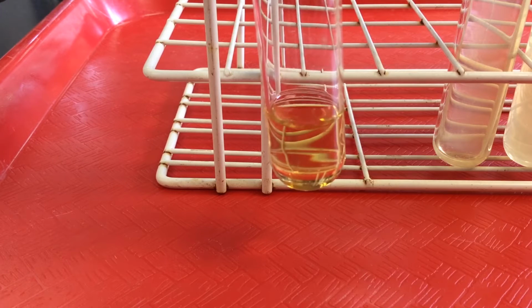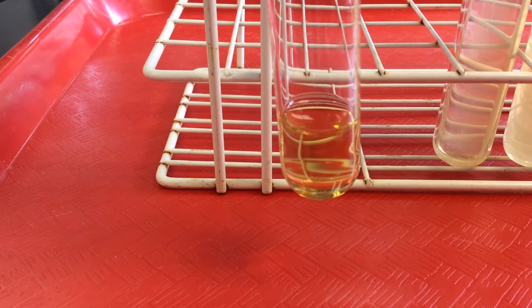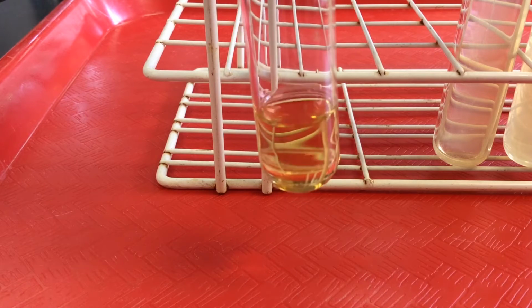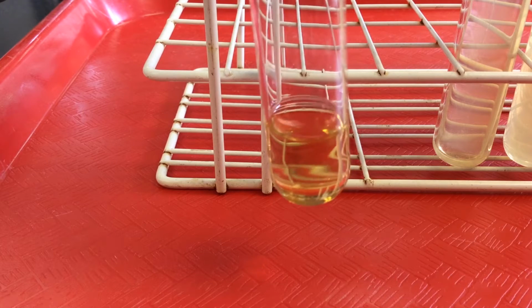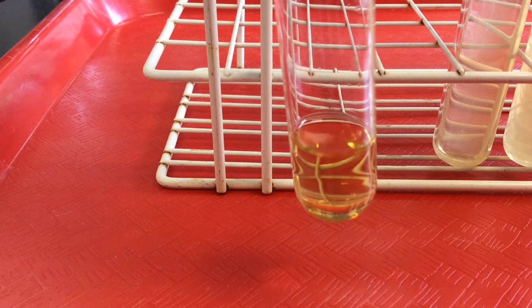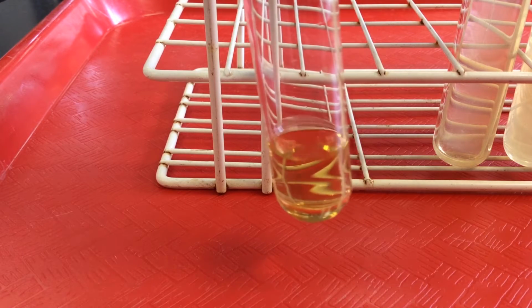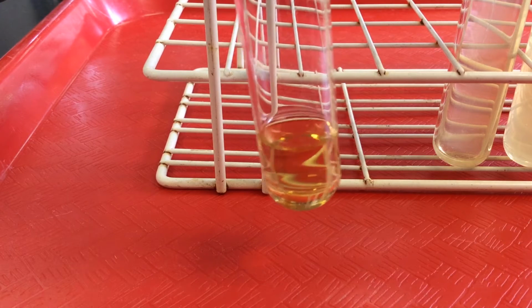You can see that this broth, which is tryptic soy broth, is transparent. It's not cloudy. It's not turbid, suggesting that this broth has probably been autoclaved, destroying all cellular organisms. And thus, we're hopeful that it's sterile. So we could transfer microbes into this broth if they had the transport proteins to transport nutrients from the broth across the cell membrane. If they had the enzymes to use those nutrients, then they could grow and divide, and eventually we'd see that the broth would become turbid, suggesting that cells are present.